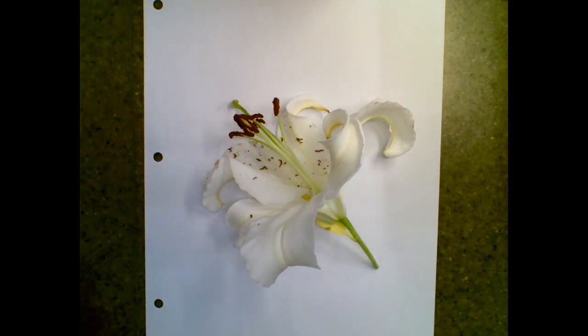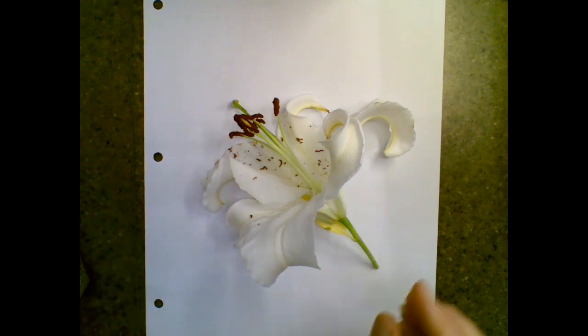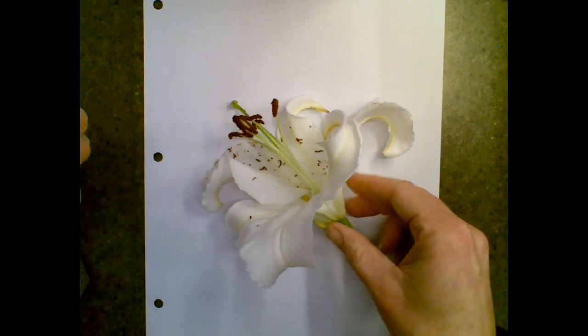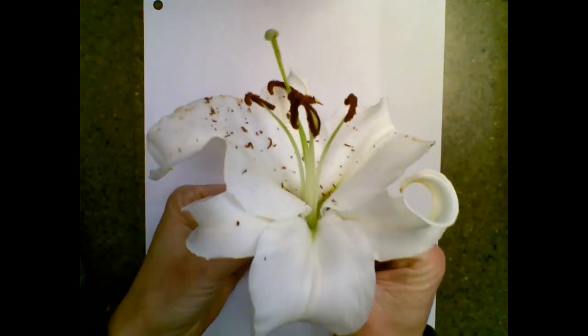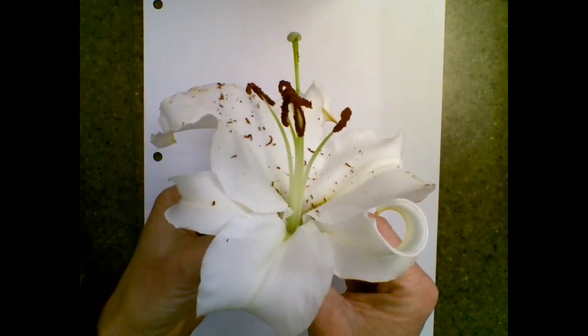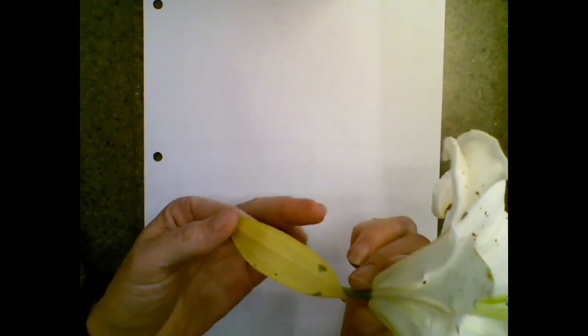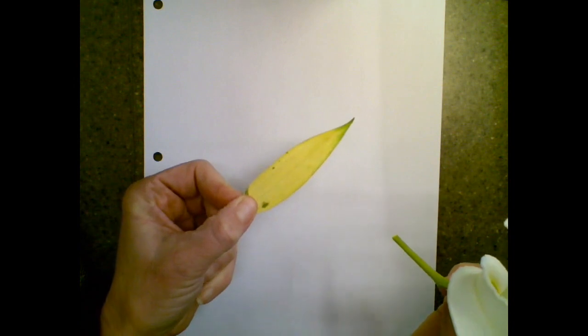Okay, so you guys just learned about monocots and dicots and the differences in the leaves. There are differences in the seeds, the stems, and the flower. So everywhere you look, if you're paying attention, you can see the differences. We're going to go through the parts of a flower, and then you're going to end up drawing all the parts of the flower. Right away, if I see one of the leaves under here, I can see that it weirdly is yellow, which is not supposed to be, but it has parallel veins.